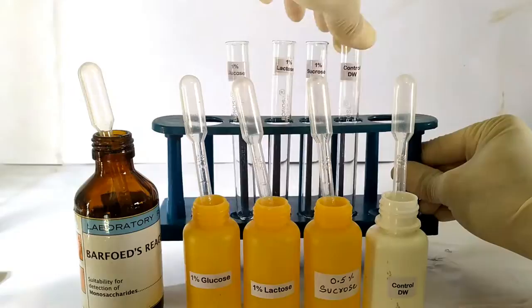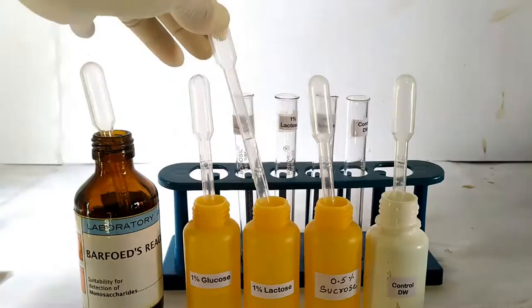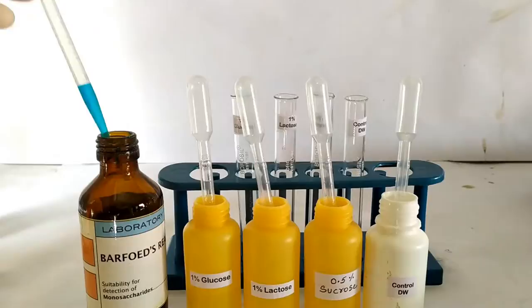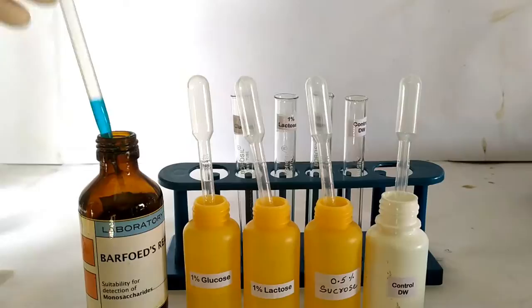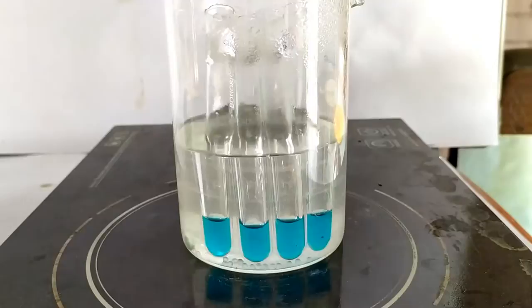To begin the test, take the 4 labeled test tubes in the test tube stand and add 1 ml each of the test sample and the control sample, which is distilled water. The concentration of the non-reducing disaccharide sucrose sample should not exceed 0.5 to 1%. Add 1 ml each of Barfoed's reagent to the 4 tubes and mix them well. Keep the test tubes in the water bath for 1 to 2 minutes, but not more than 2 minutes. Note down the appearance of color in the test tubes after 1 or 2 minutes.